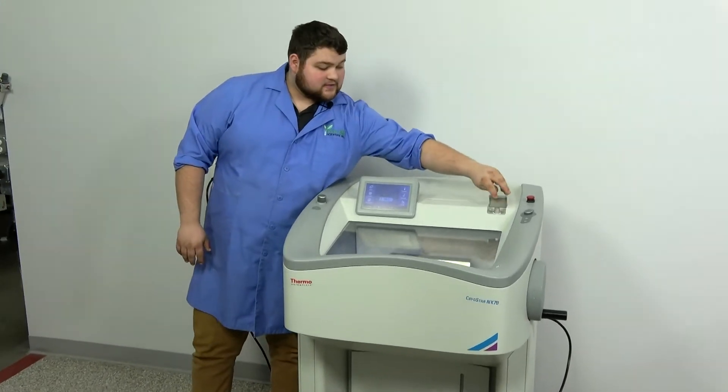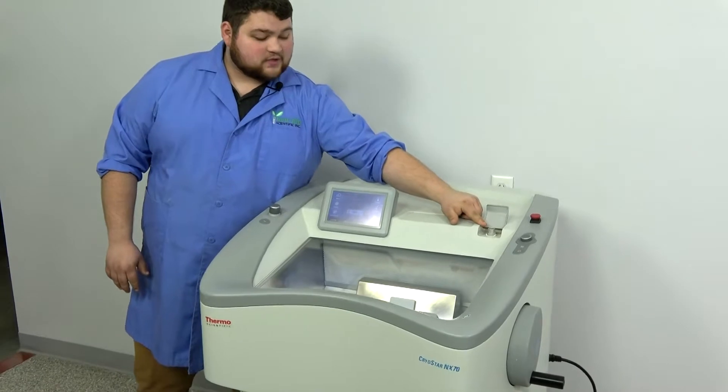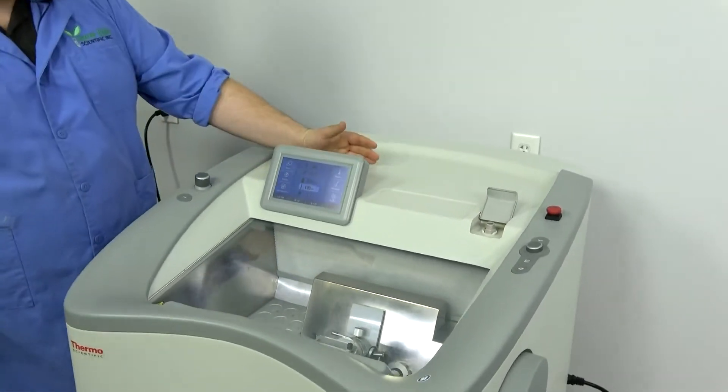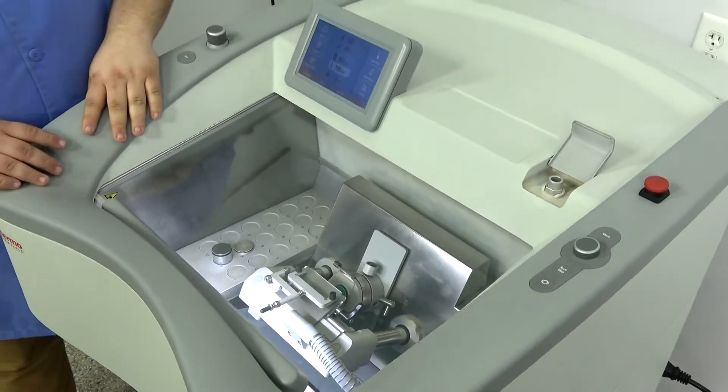We'll start up here at the top. It's got your disinfection right here. Put your chemical up, put your disinfectant in and we can disinfect the chamber.